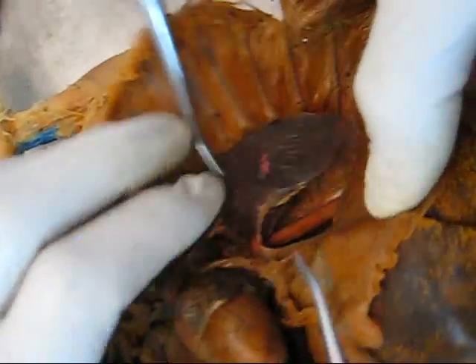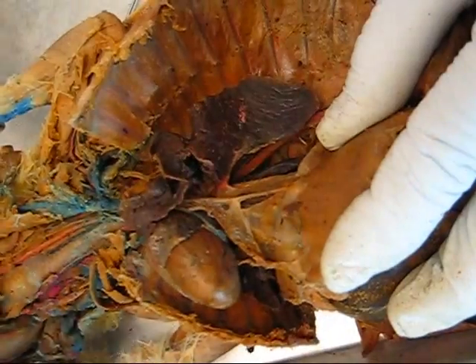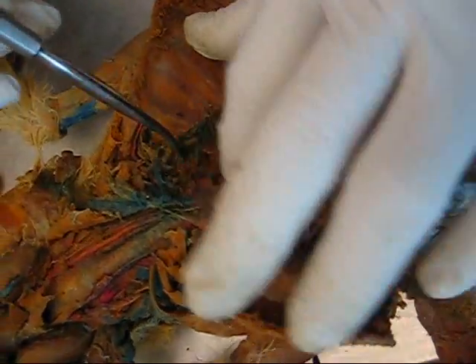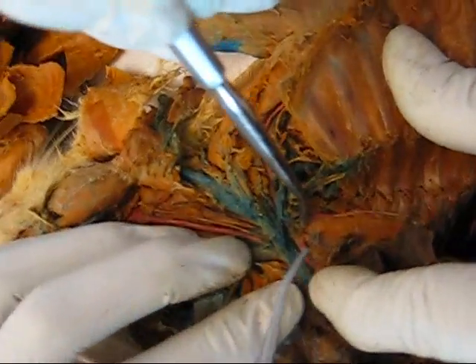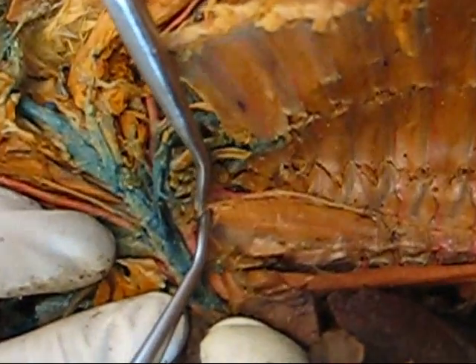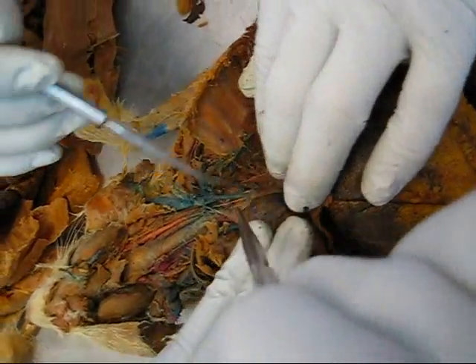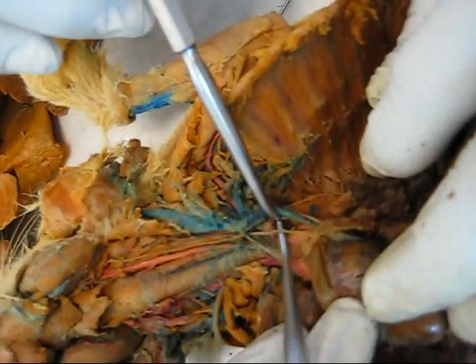Right and left phrenic nerves — here we have the phrenic nerve, the left one, going to the diaphragm. Stellate ganglion is this cluster of cells here at the end of this sympathetic chain trunk — underneath all of these blood vessels. Right and left vagus nerve — here, runs into the heart. Right and left sympathetic trunk — here, along the vertebral column and the thoracic cavity.